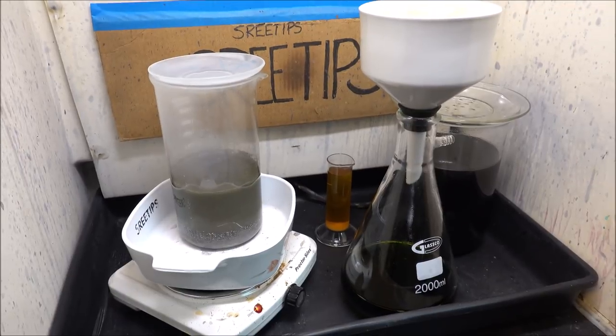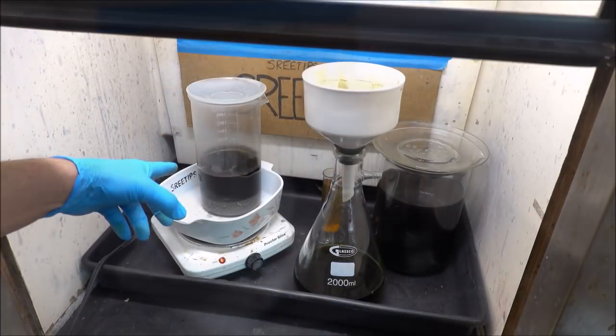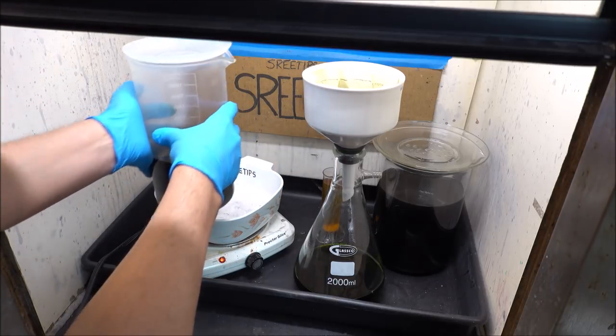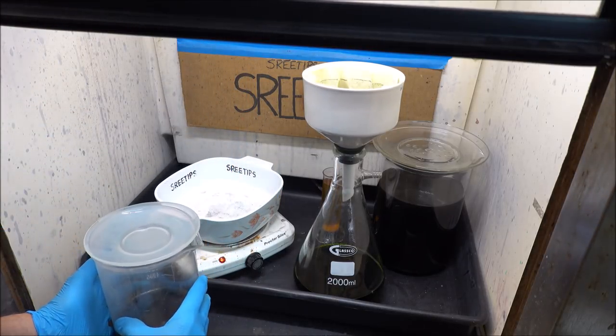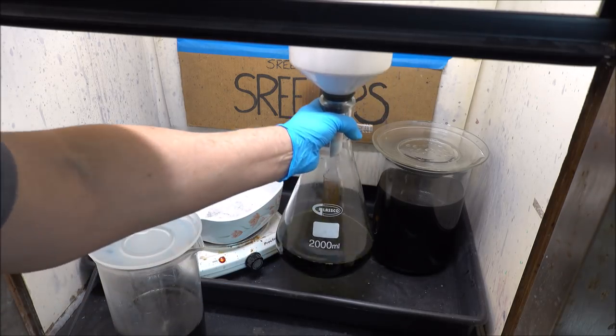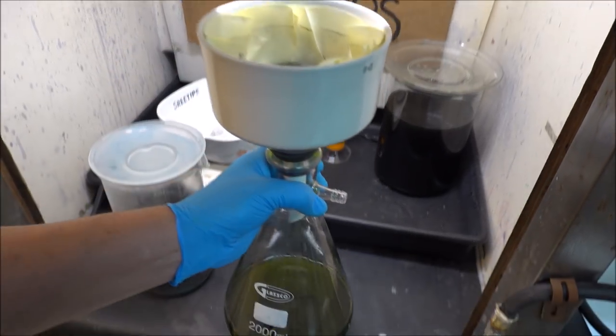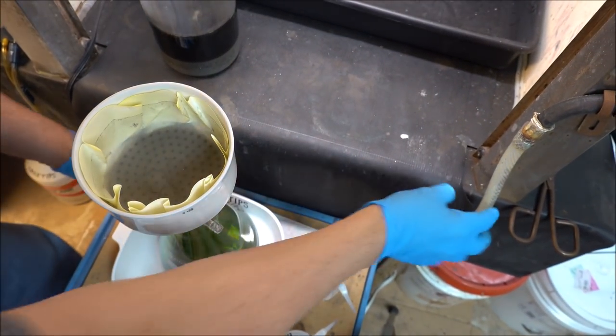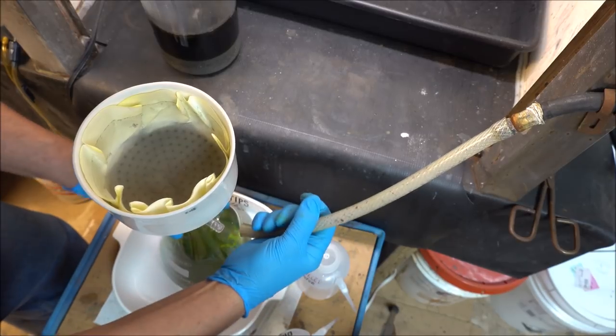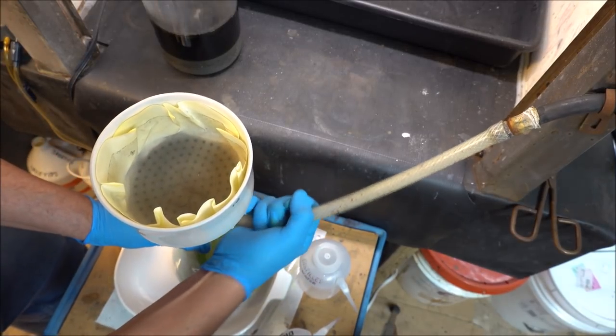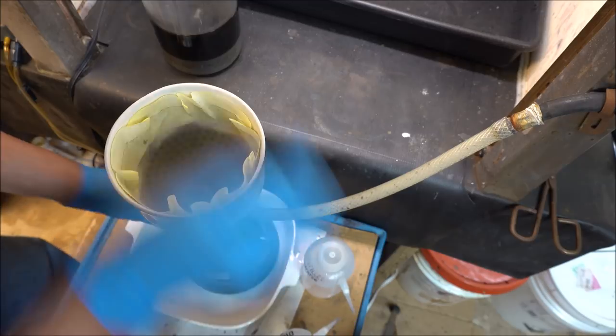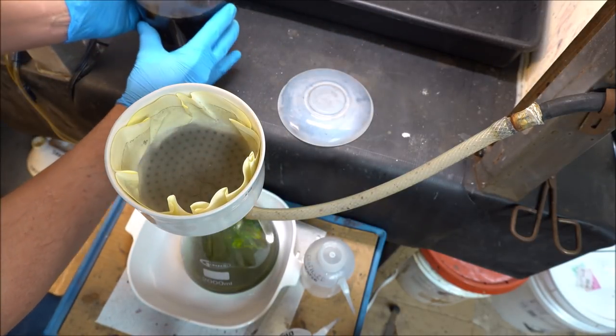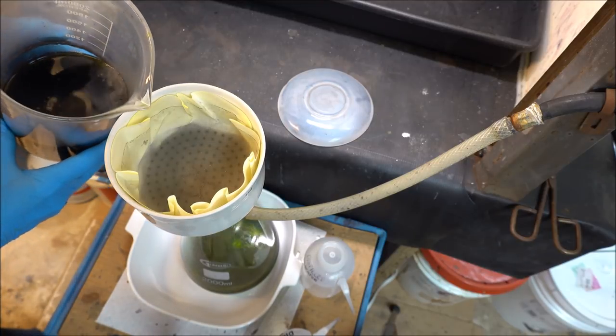My solution has been allowed to settle and cool now. This is the second hydrochloric treatment. Notice it's still very dark green. That's what I'm going to try to get rid of here. So what we're going to do is pour this second hydrochloric treatment off into this same filter and do another one. I'm going to keep doing this until I get that hydrochloric acid to clear up.